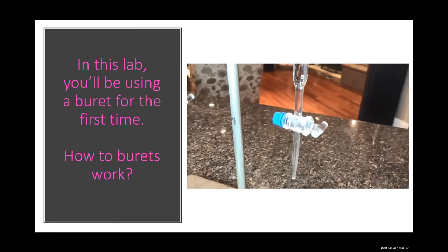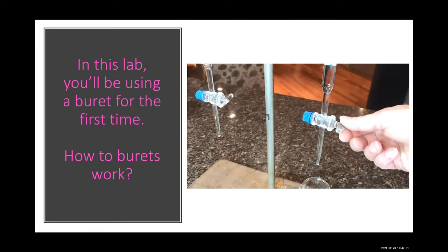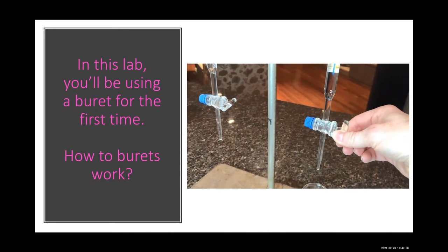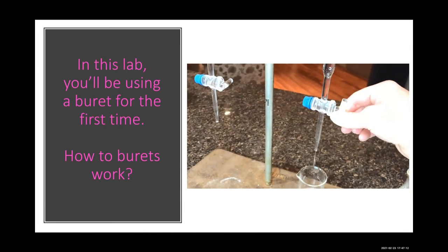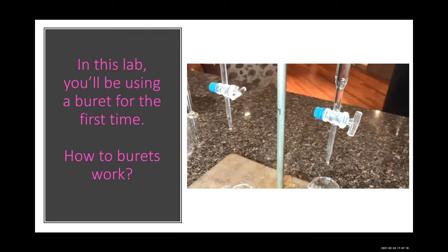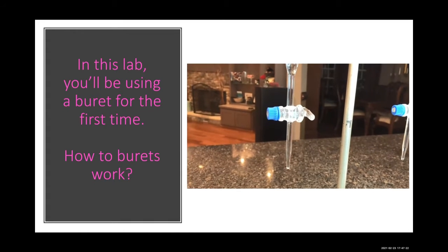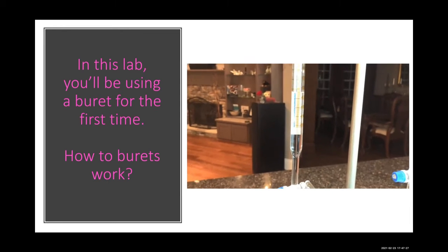this is called a stopcock. And if you turn the stopcock to open it by going this way, you'll see that it will start to first drip slowly, see? But you can also make it go fast if you want. The way you measure from a burette, I have to go to the other one at this point. We should make sure it's totally turned on. So the way you measure using a burette is you kind of have to think backwards math.